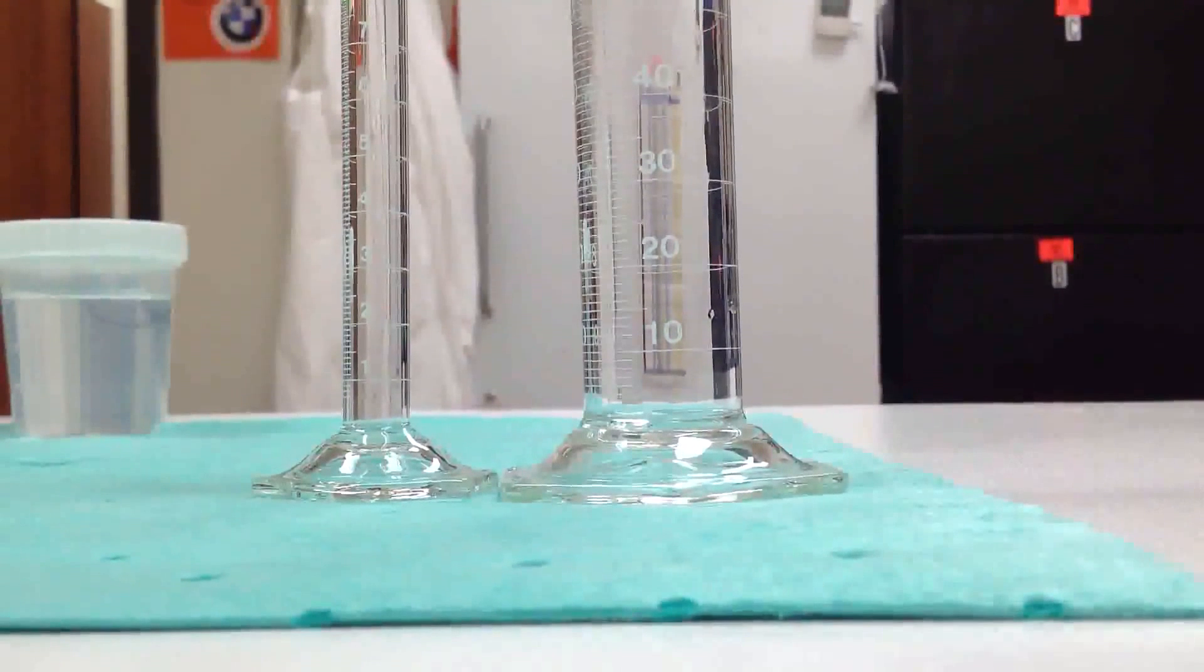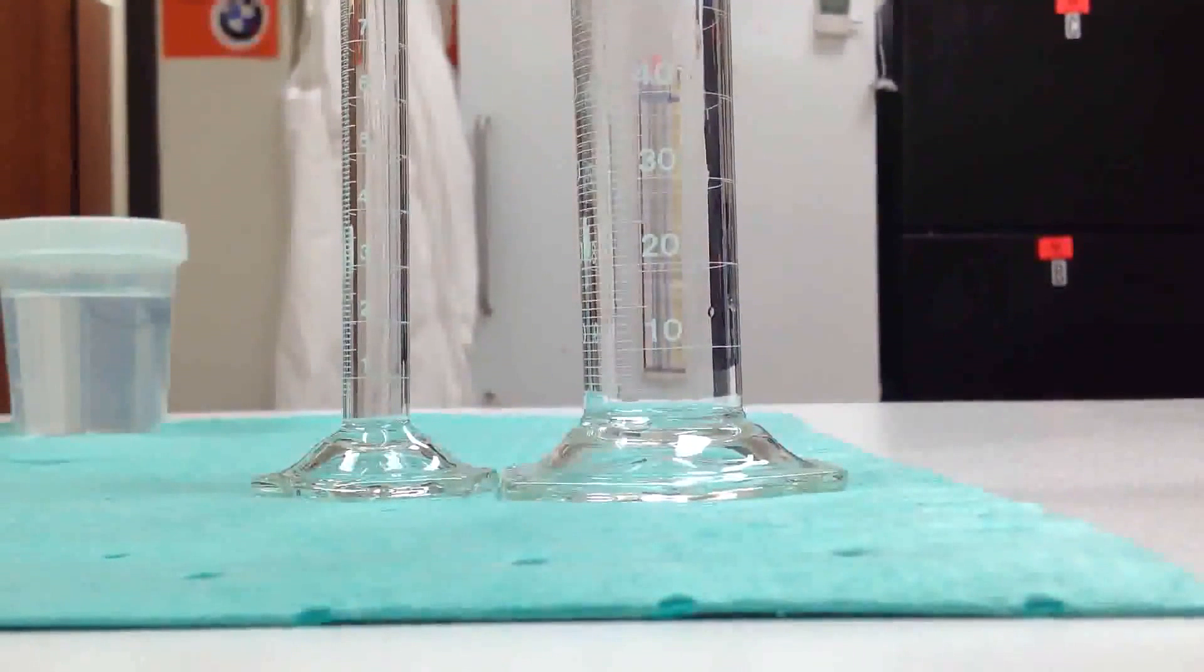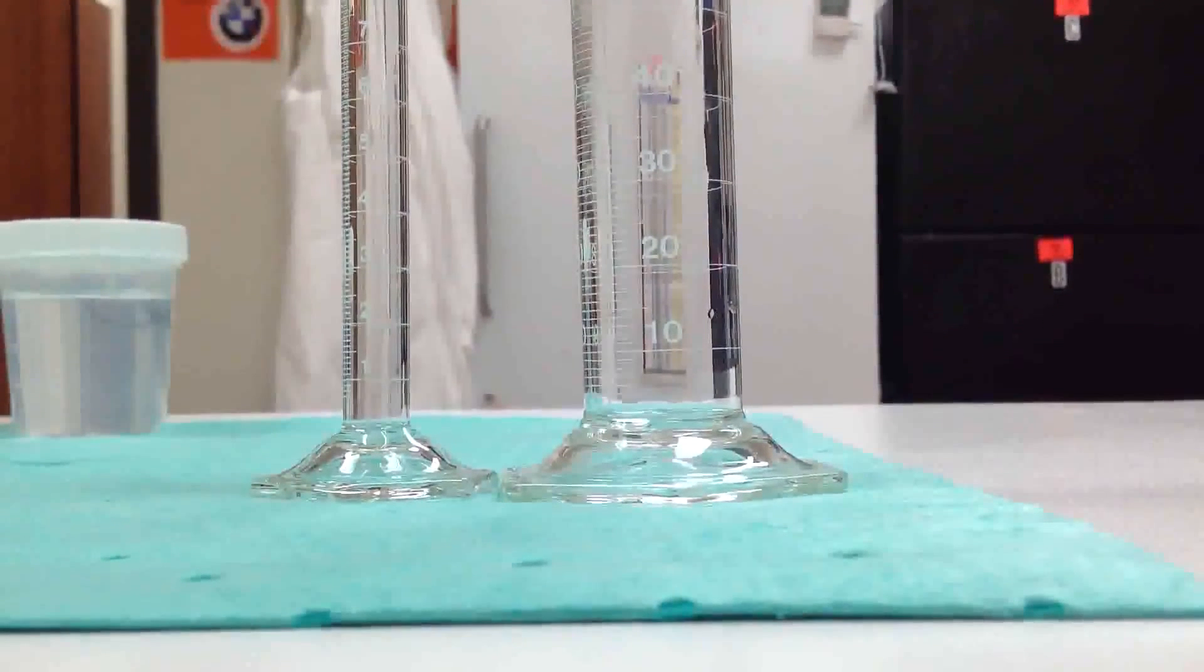This lesson is measuring. We're going to transfer a fluid into a graduated cylinder.